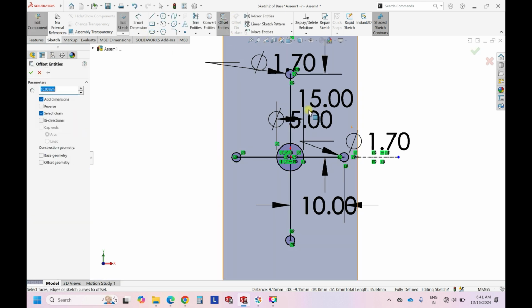So now create the offset entities. So offset entities is basically for channels. Since we have seen that inner channels are lower in channel width when compared to the outer channels, we do the same way. For example, we can keep it as 0.25. So 0.25 mm is 250 microns, and then we can choose bidirectional. So bidirectional gives this 0.25 on two sides, so it is a 500 micron channel.